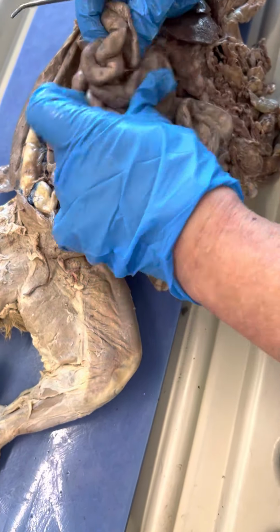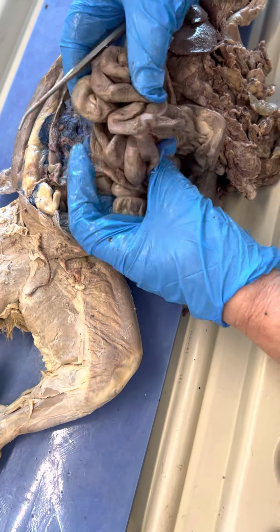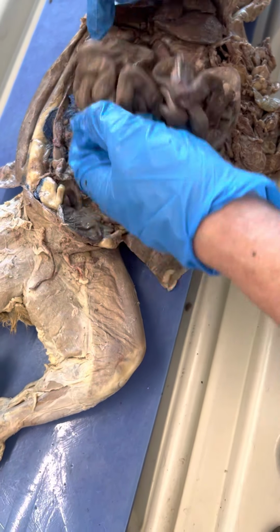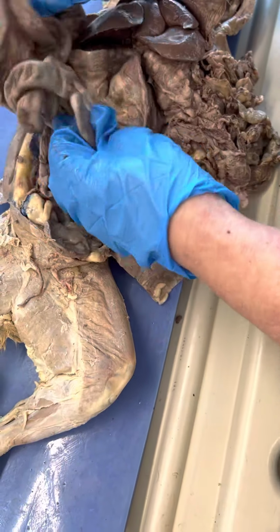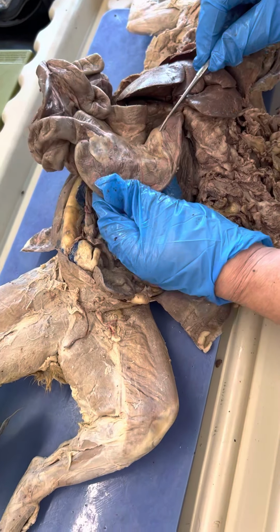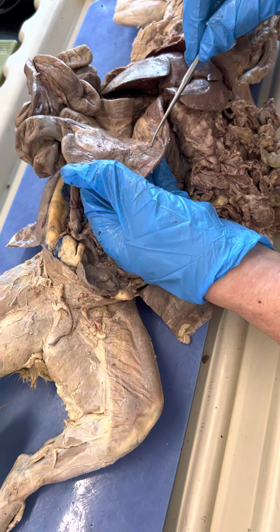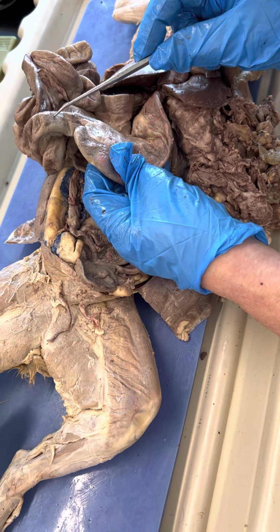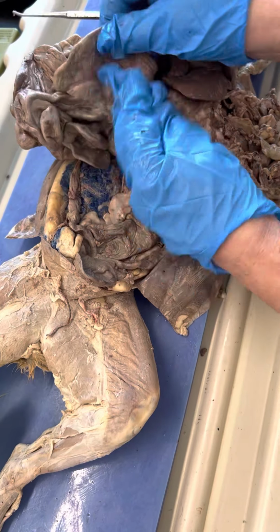Then the first part here would be the jejunum, and the last part is the ileum. They're kind of hard to separate, but if I go right here, I would know this is jejunum. Then to be sure on a lab test, the ileum is the last part. It's going to connect to the large intestine. You can see the difference. So this is small, this is probably ileum here, and this is large. So if it's like this and they ask what this is, I would double my bets. I'd put small intestine / ileum. Then this would be the large intestine.